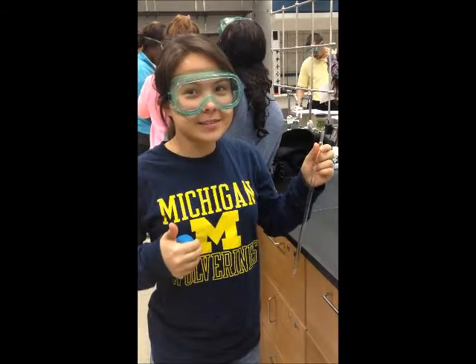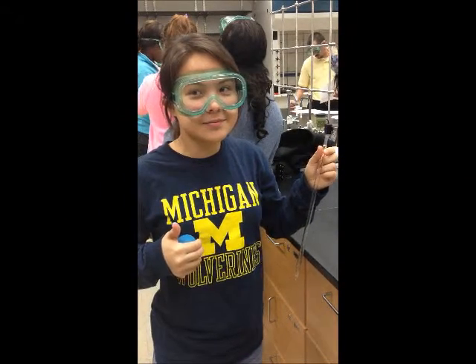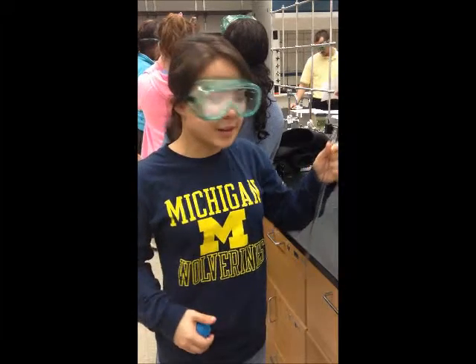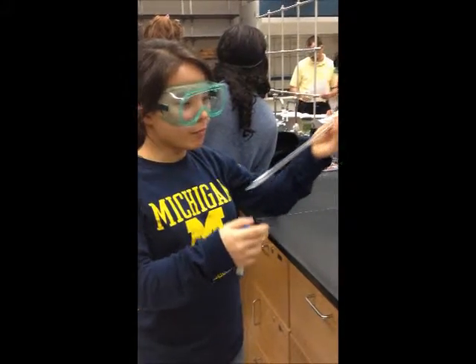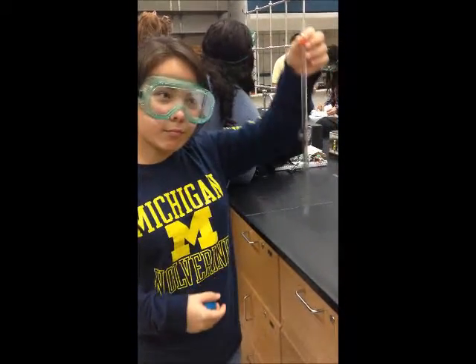This is lab partner number 1. In this video, she will demonstrate how to calculate the volume of a solution by difference. This is a pipette. It is a precise measuring device used for finding the volume of a liquid.